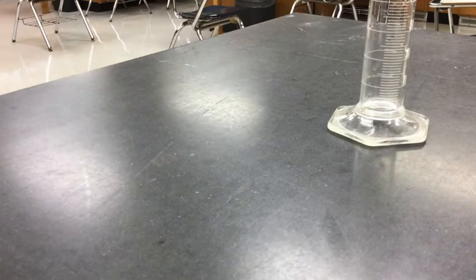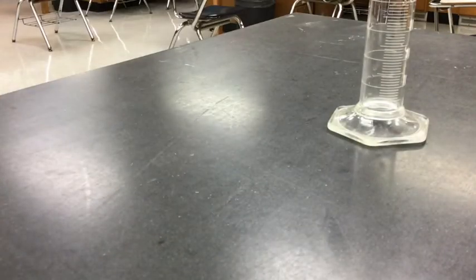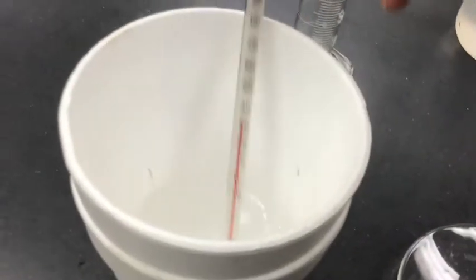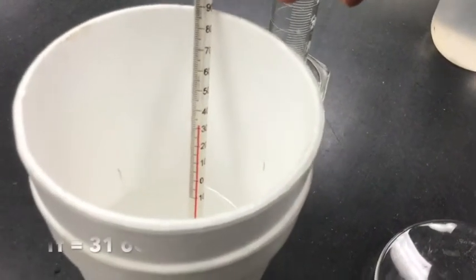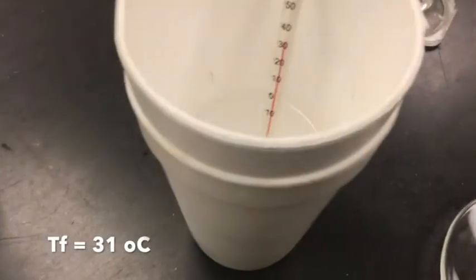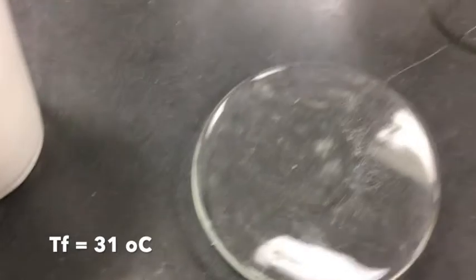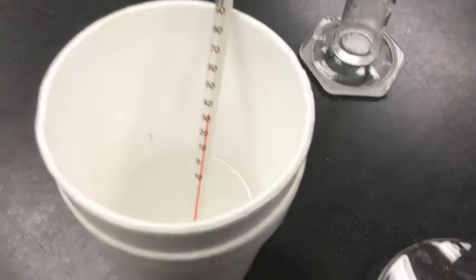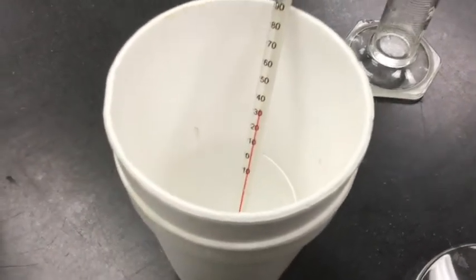So at this point, our temperature has topped out at about 31 degrees Celsius. So I started at 23, it went to 31, which is an increase of 8 degrees Celsius for reacting 1 gram of the magnesium oxide with the hydrochloric acid. Armed with that knowledge, we should actually be able to figure out what the delta H of the reaction is.